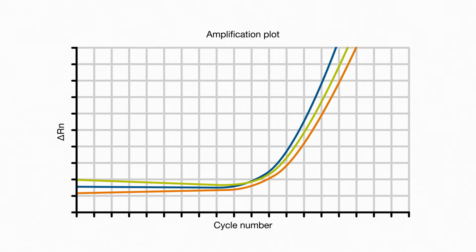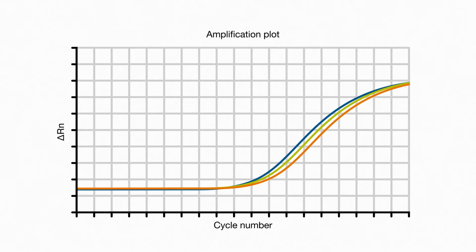Here are our data prior to baselining. Note how every sample begins from a slightly different spot on the y-axis, causing our geometric phase data, this curvy part over here when we're in a linear scale, to look horrible. But once we subtract noise, every sample begins from the same 0.0, and as a result, the data clean up nicely. The value we get after normalizing for background is something called delta Rn. If you ever look closely at a log-scale amplification curve, the one we're used to seeing, you'll notice that delta Rn is graphed on the y-axis. By the way, the n in delta Rn has to do with Rox dye.